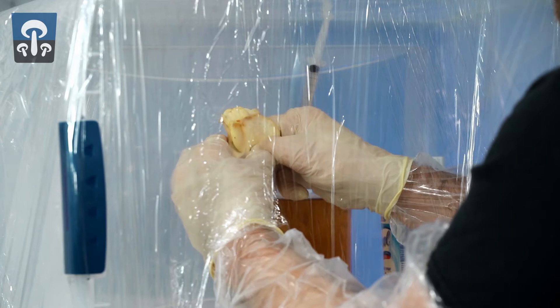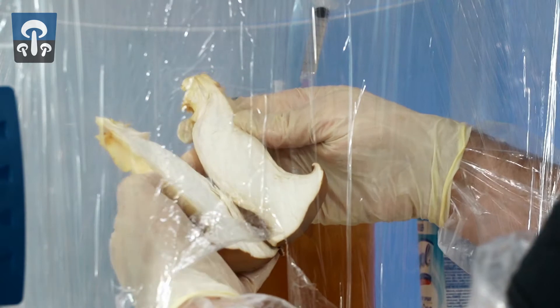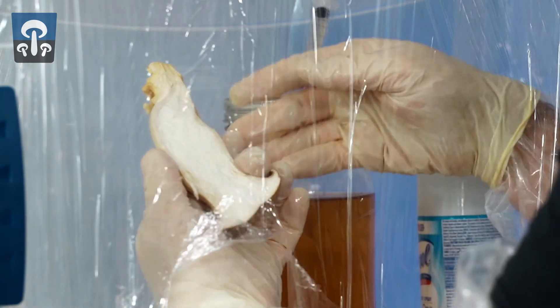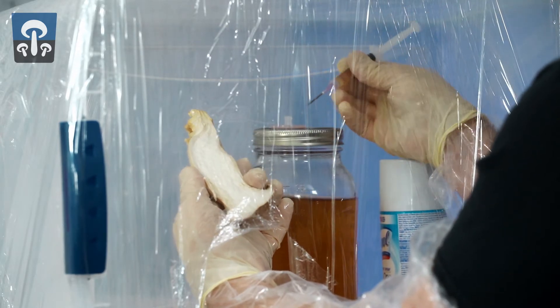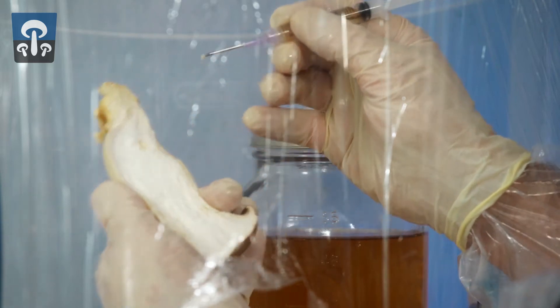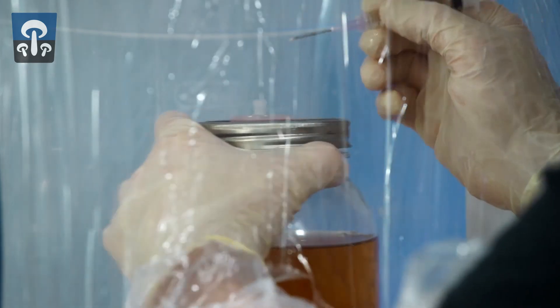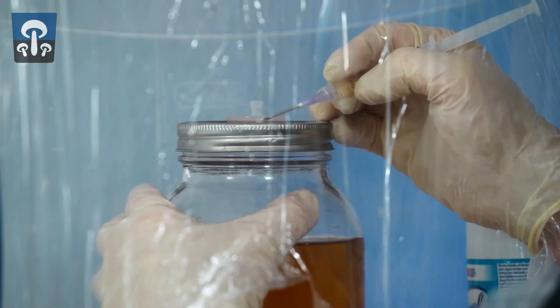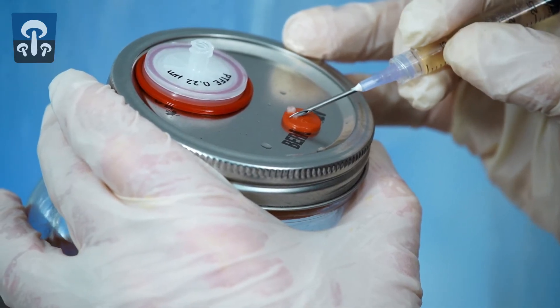It's time to split the mushroom open to expose some tissue from the inside. Do not touch the exposed inside pieces of the mushroom — you need to keep these clean. Using the sharp piece from the tip of the needle, cut out a chunk of firm tissue from the inside without touching the outside edges. Transfer this piece of tissue to the inoculation port on the top of the jar and slice a piece off with the sharp edge of the syringe.